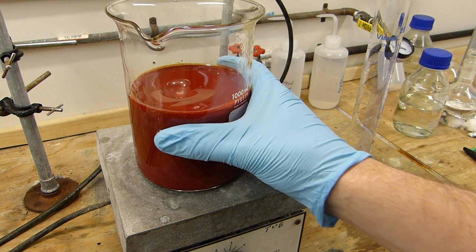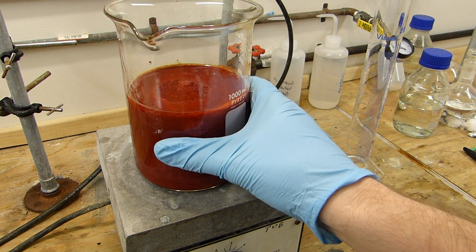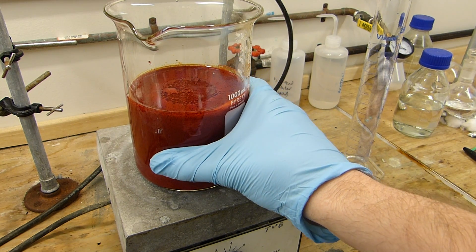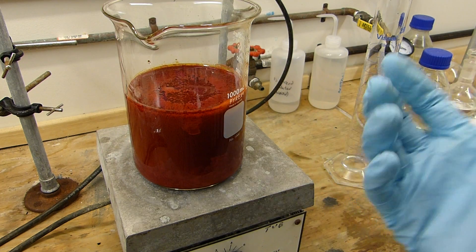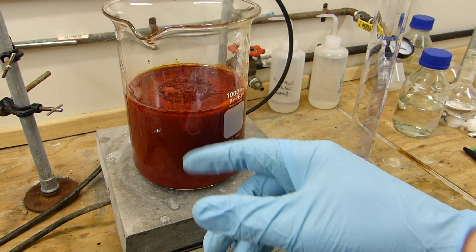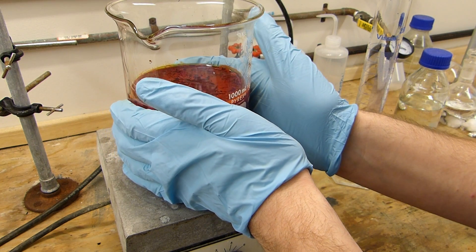So now that it's all relatively stirred together and it's also quite hot, I'm going to turn off the stirring and we'll allow it to slowly cool to room temperature to precipitate as much chromium trioxide as possible and also increase the size of those crystals which you can see now are quite abundant before we move on to the next step which is of course filtration.